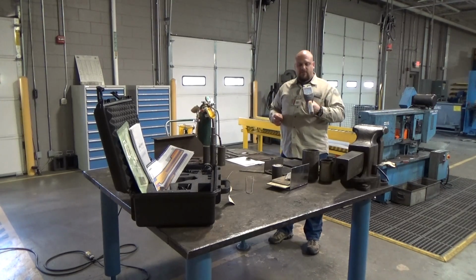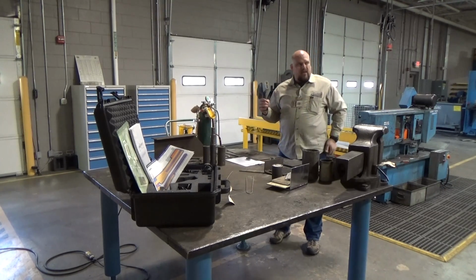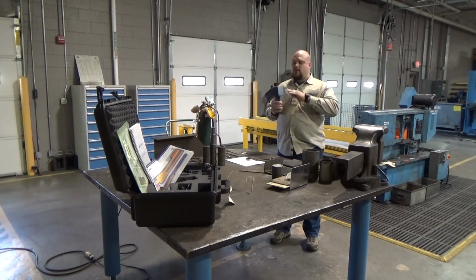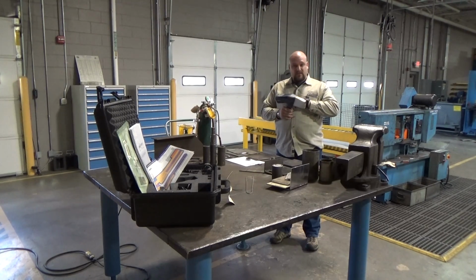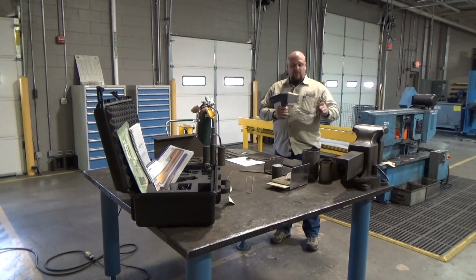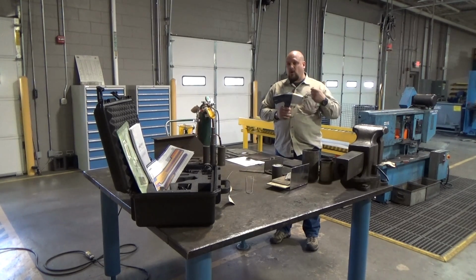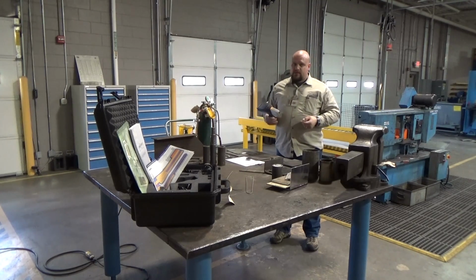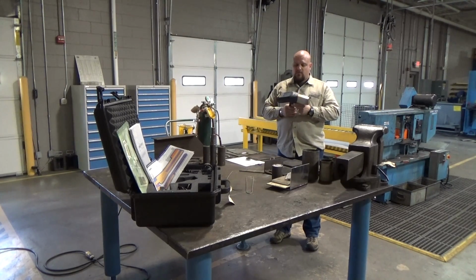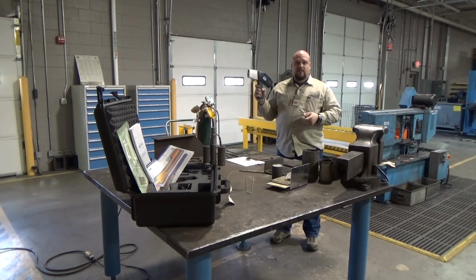Now it has a number of different settings. It is capable, I think, this database with different metals. It's got 350 some odd materials in the database, which cover most things that are out there. But again, it's ever changing, ever evolving, so there are more and more alloys being developed. So, you know, keeping that up to date can be very important. It is capable of having soil software, so you can take soil samples and understand what's going on in the soil. But you find this to be used a lot of times in scrap yards.